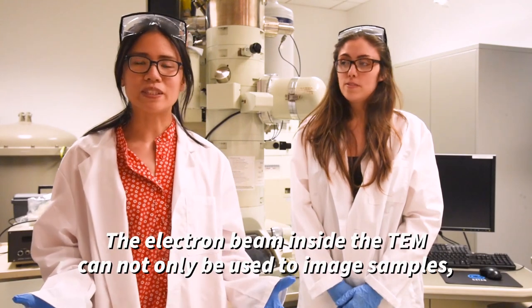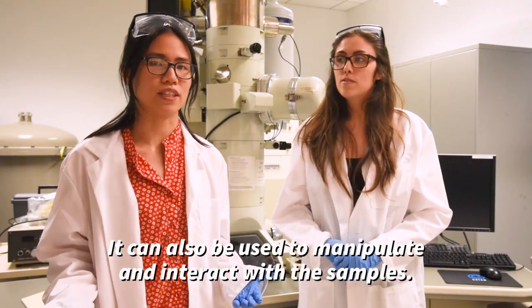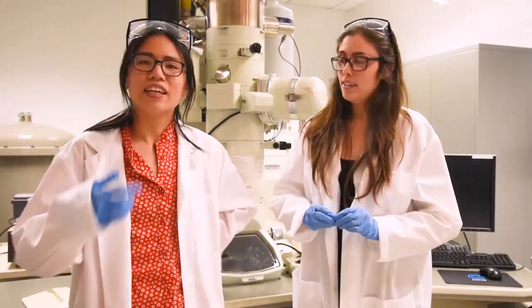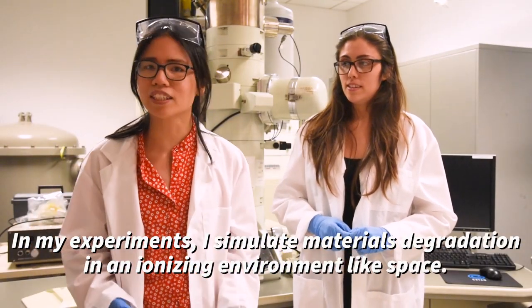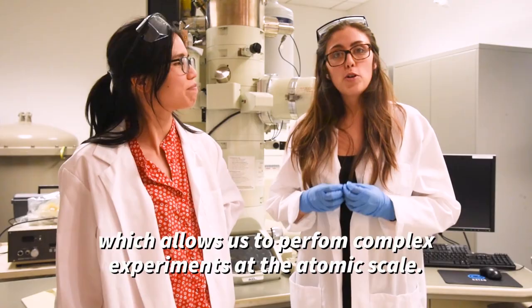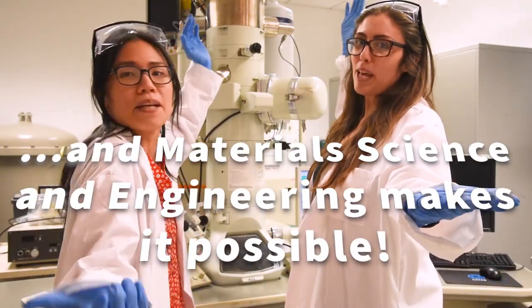The electron beam inside the TEM can not only be used to image samples, it can also be used to manipulate and interact with them, turning the microscope into a mini lab. In my experiments, I simulate materials degradation in an ionizing environment like space. Overall, the TEM is an incredibly powerful tool which allows us to perform complex experiments at the atomic scale — and material science and engineering makes it possible!